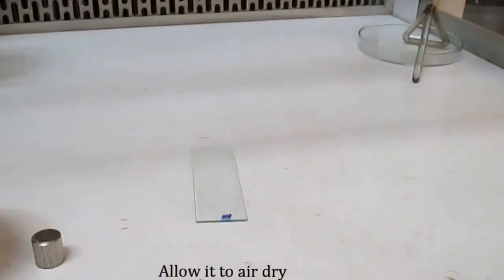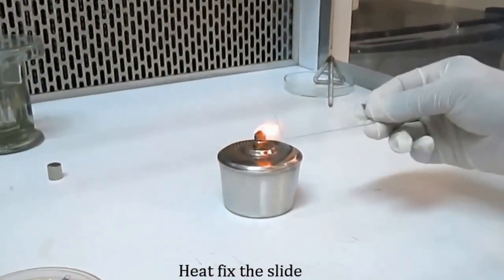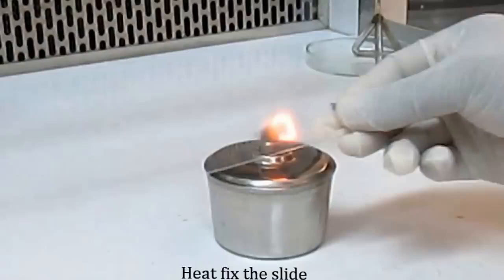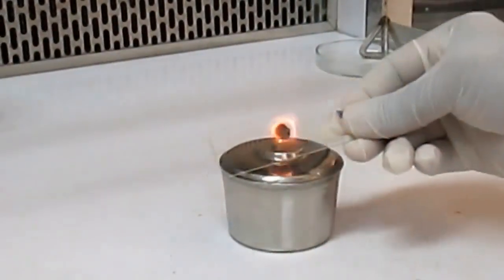Then allow the slide to air dry. After some time, heat fix the slide by just passing the slide over the flame for 2 to 3 seconds.